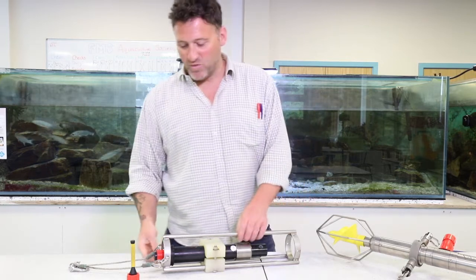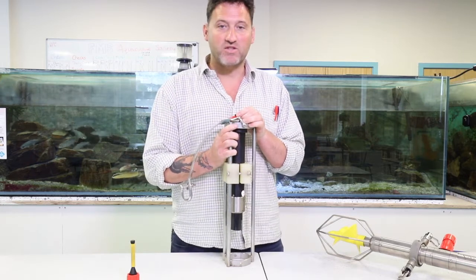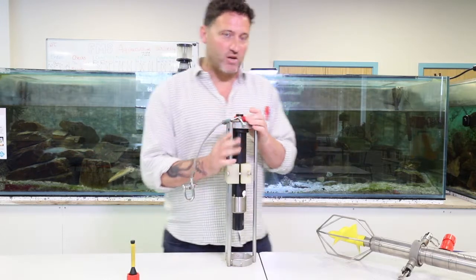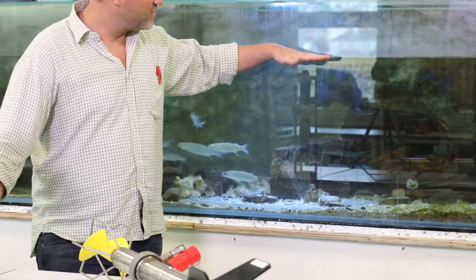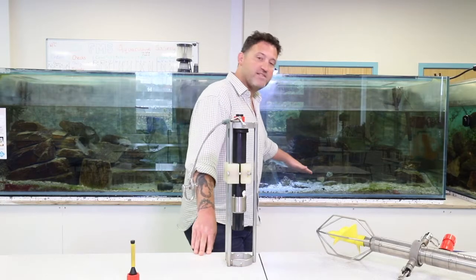Okay, so we'll look at the CTD. So what is the CTD? Well, the CTD is a probe that measures conductivity, temperature and depth. Now in the ocean, this is a really important thing to measure, because as you go deeper and deeper into the water, you'll see different columns of water broken up by their temperature, broken up by their salinity, but of course broken up by their depths as well.